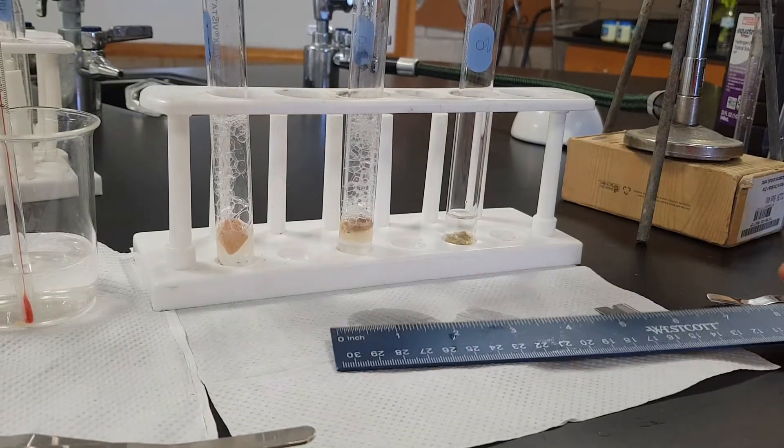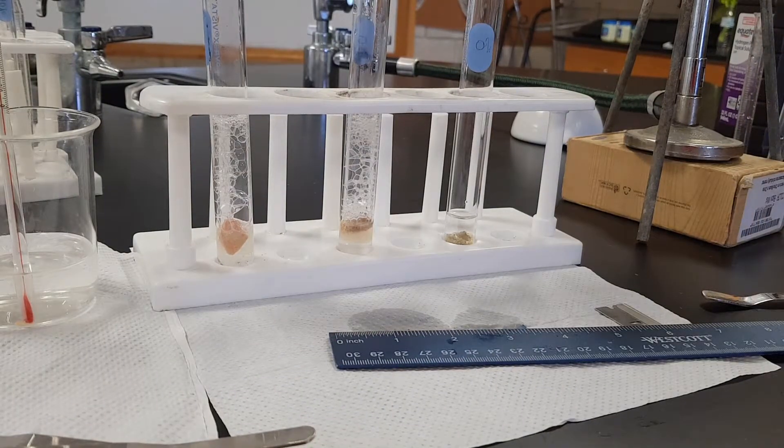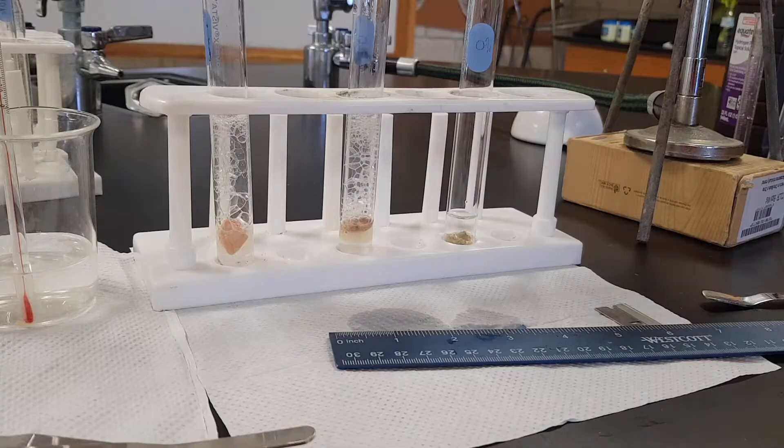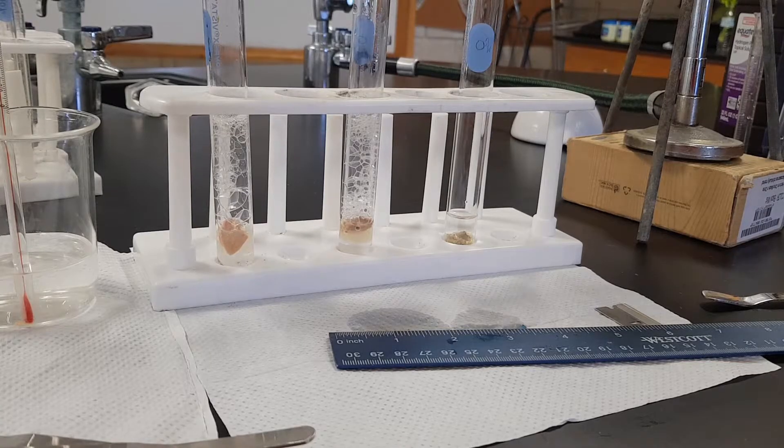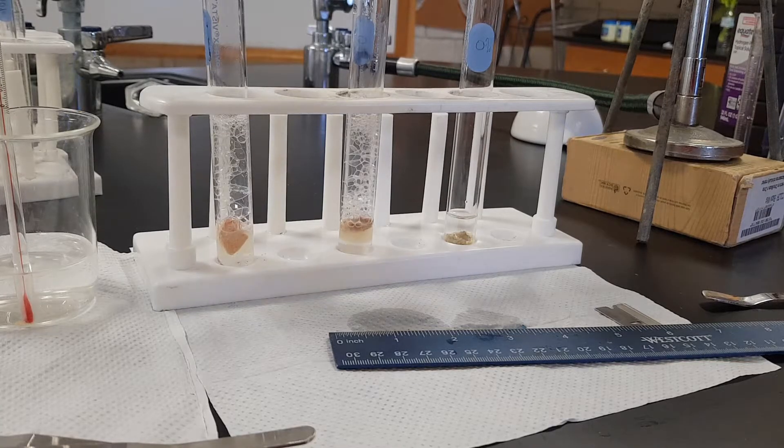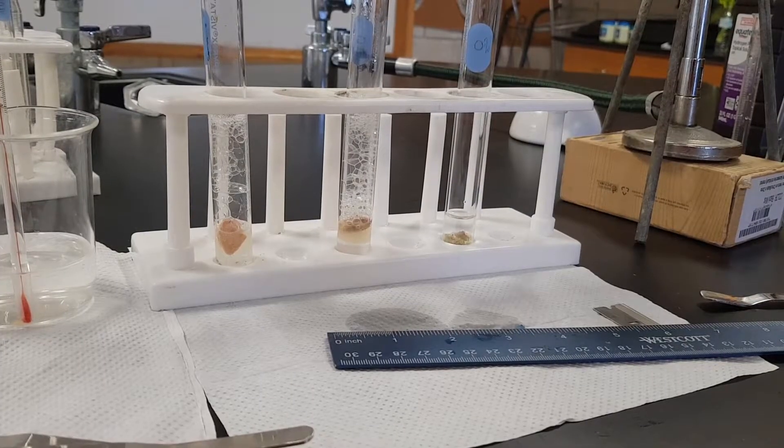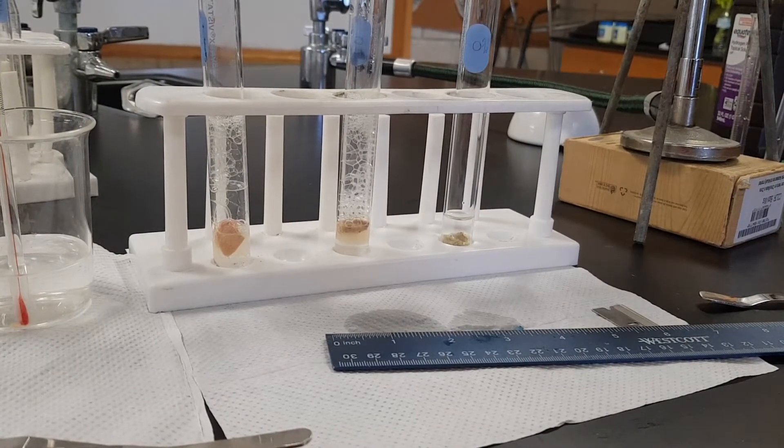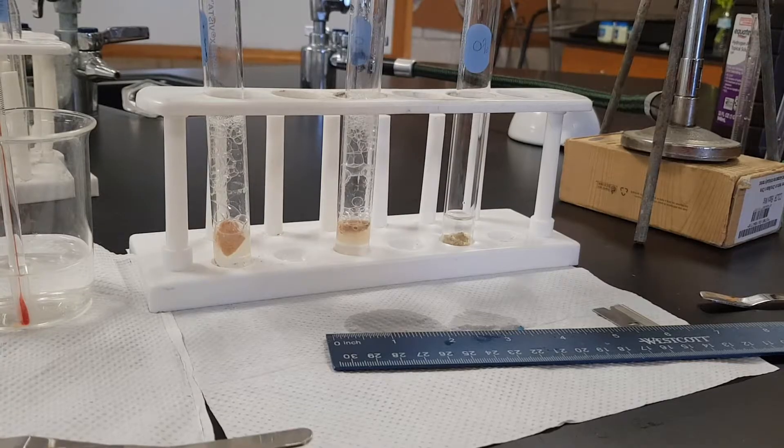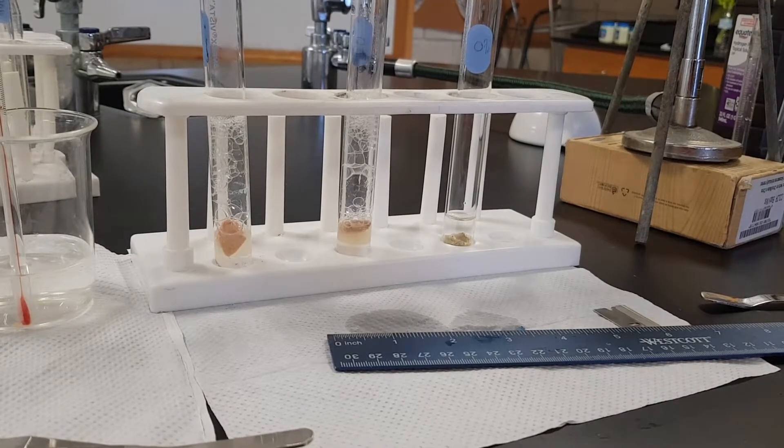Once you do that, you can now analyze your results and compare the height of foam formed. In fact, you can find the volume of foam that was formed.